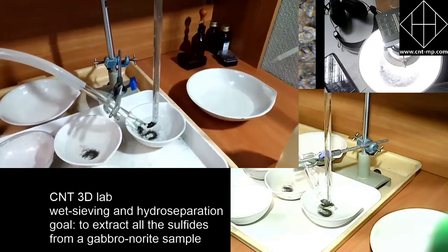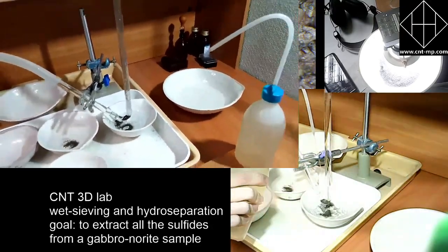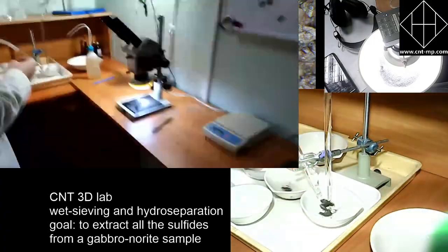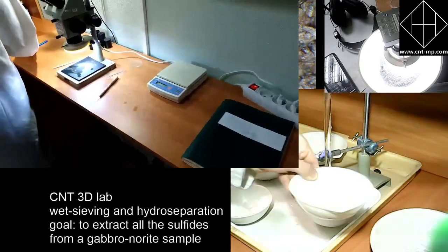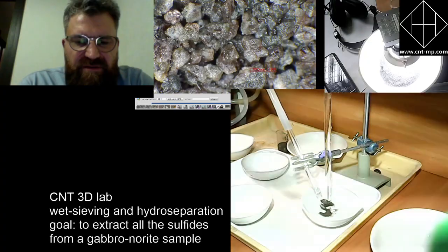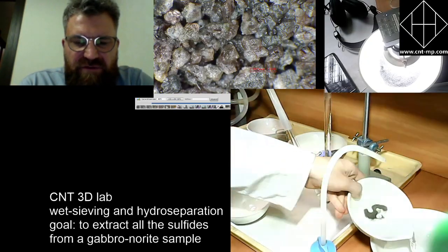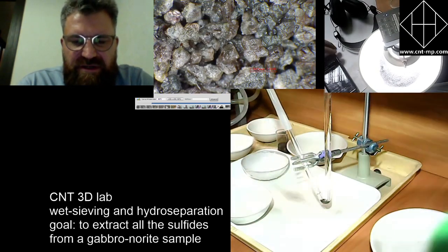Hello, guys. Can you actually reject the concentrate from the tube? Is it ready already? Yeah, you can see that the final, the preliminary, I would say, in this case, because it's still a lot of material at the bottom, but that amount of material can be reloaded from the glass separation tube onto the separate dish.